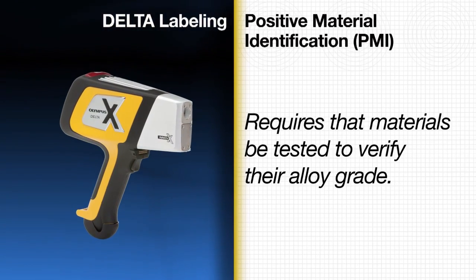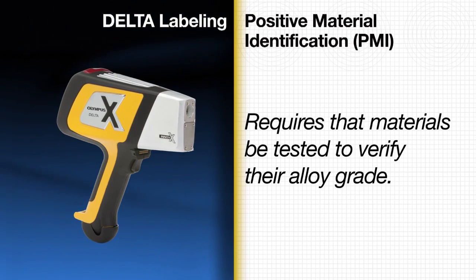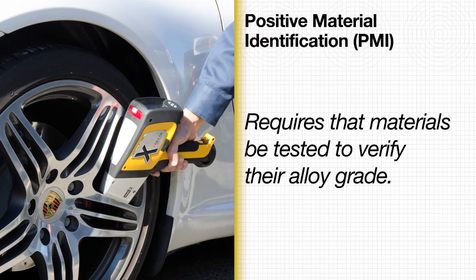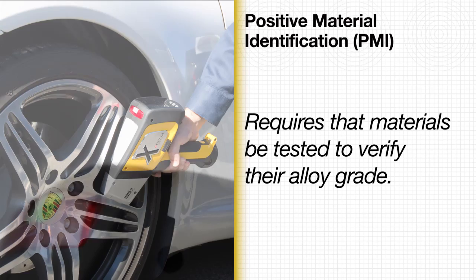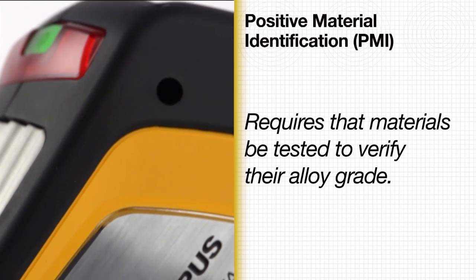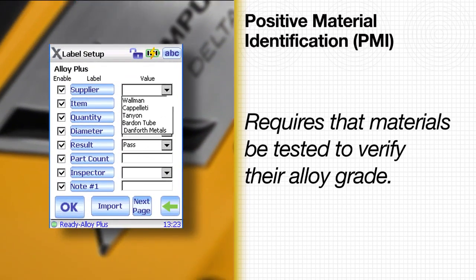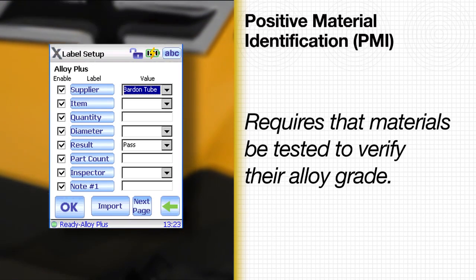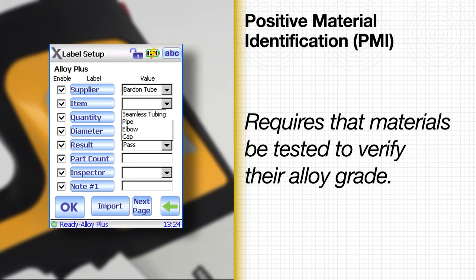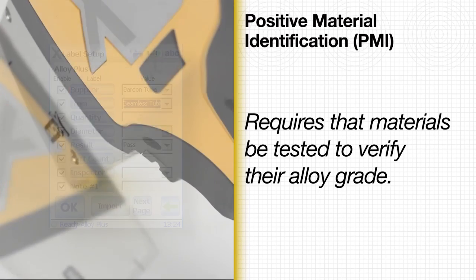Positive material identification, or PMI, requires that materials be tested to verify their alloy grade. In this video, you will see how the Delta XRF analyzer has a unique labeling feature that streamlines the labeling of alloy material verification tests.